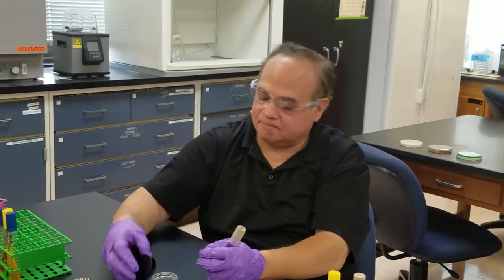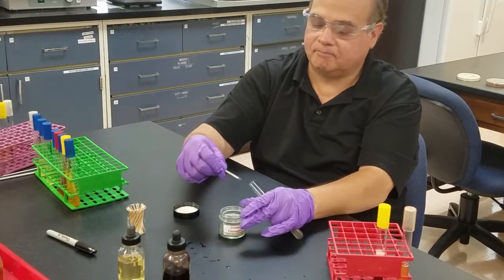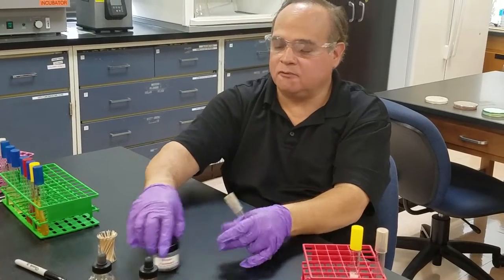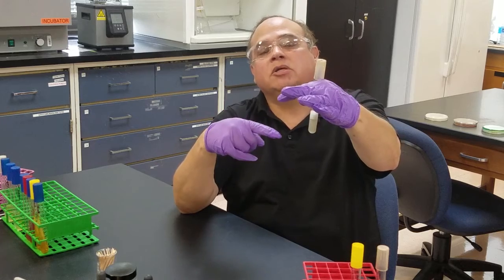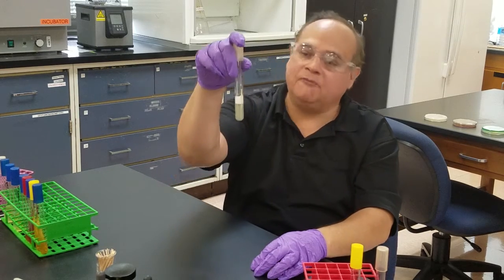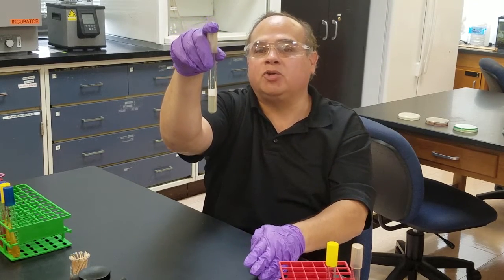So in step two we add some zinc. If you recall, when we added zinc to the Enterococcus faecalis negative test, it turned red after a few shakes. Here, no matter how long I vortex it, it will never turn red because nitrate has been reduced to nitrite and further reduced to a gas — nitrous oxide, nitrogen, or ammonia. Since nitrate is not present in its pure form, we conclude it was reduced to a gas. After zinc addition, no red color means a positive result for reduction of nitrate to a gas.